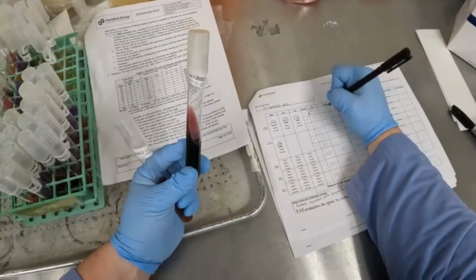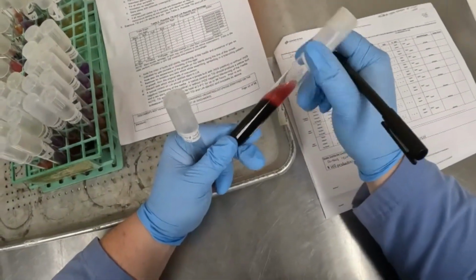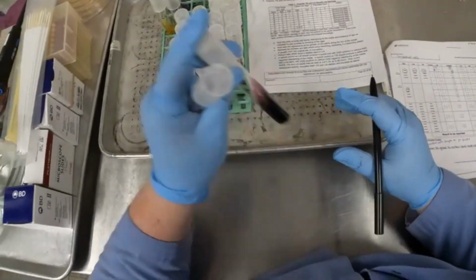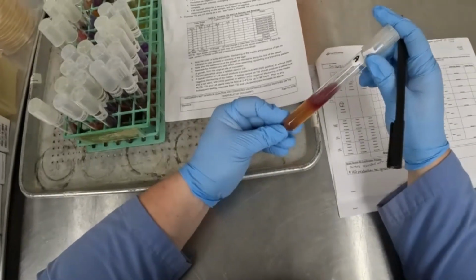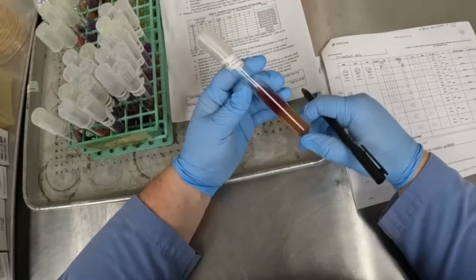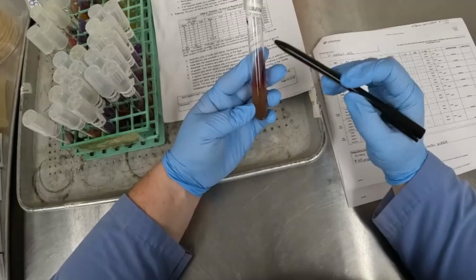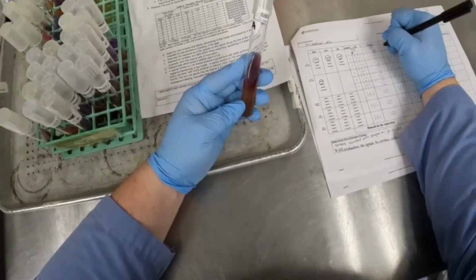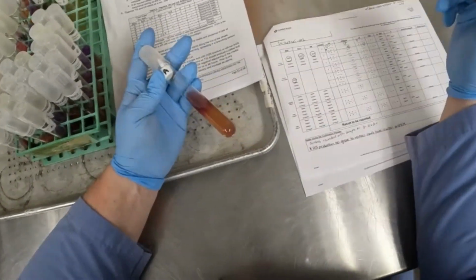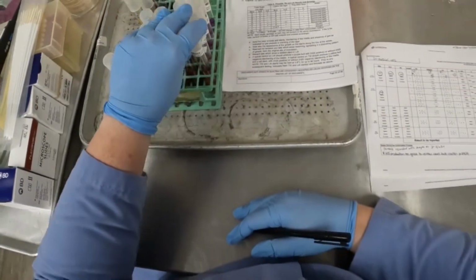So obviously it has H2S, so yes. Does it have any gas? It's a little difficult to tell, but I don't believe so. So I'm going to circle N for no. And let's take a look at the LIA reaction. It's interesting, this LIA reaction actually doesn't have any H2S production, which is a little different. But this is definitely purple over yellow, with no H2S production. So we'll just circle the N for no, or none.